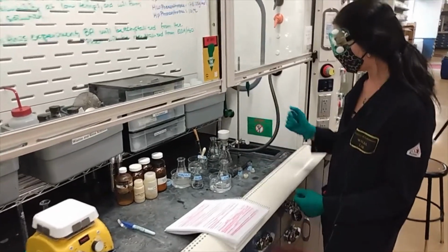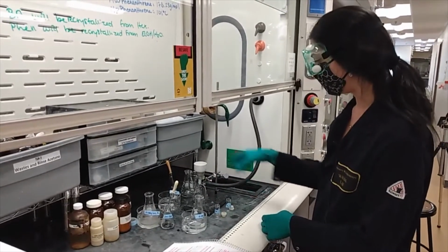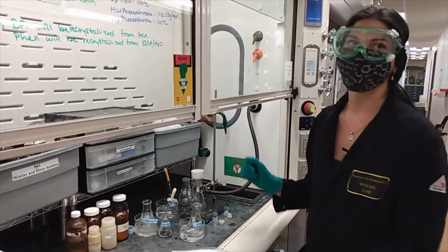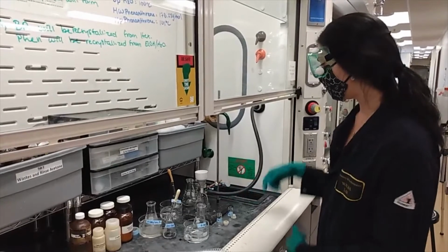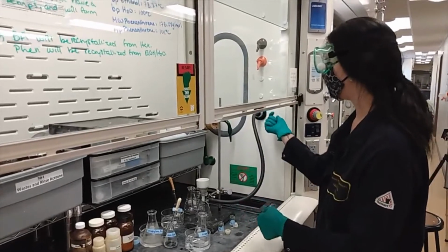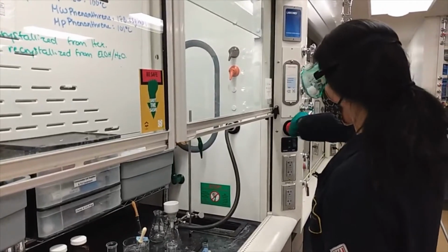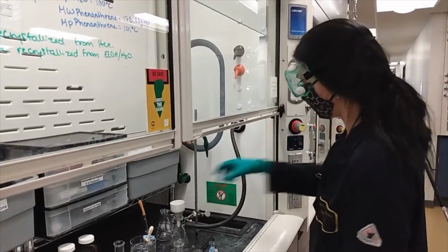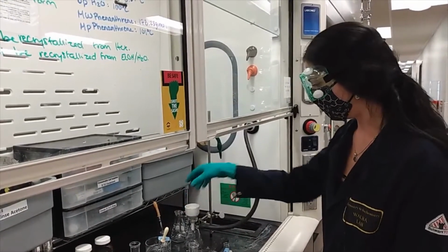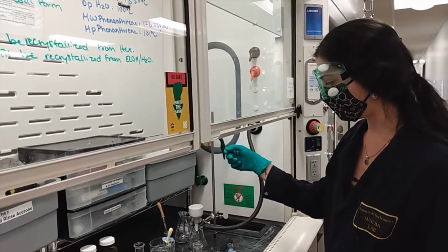So you set up your filtration apparatus using an Erlenmeyer flask with a side arm attached to it, and grab a rubber gasket that will be equipped with your Buchner funnel. And attached to the sidearm, you can collect a vacuum hose, attach it onto the sidearm flask and into the vacuum port, turn on the vacuum, by pulling air through the system. Okay. And then you can collect a piece of filter paper and put it into the Buchner funnel.